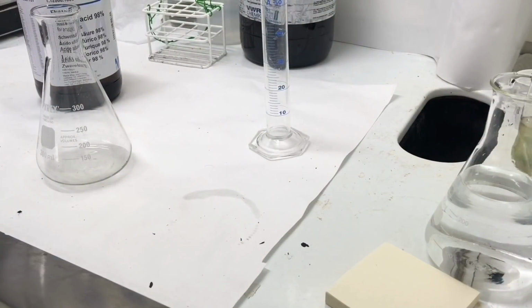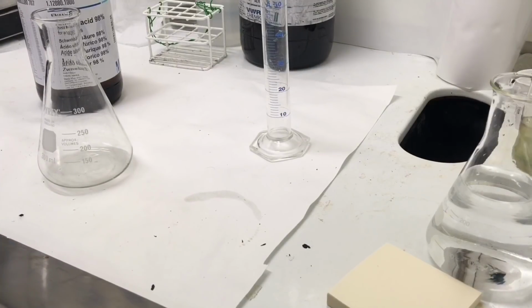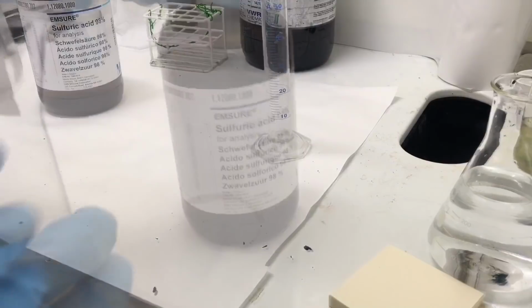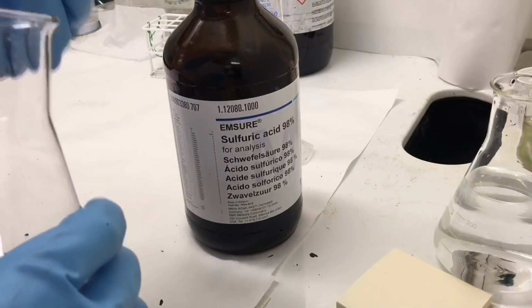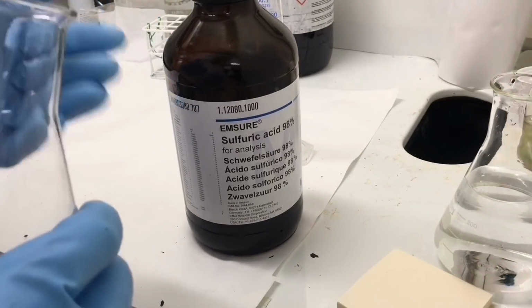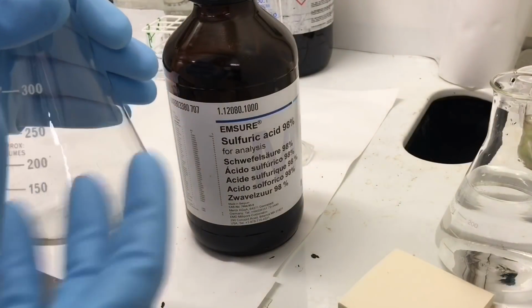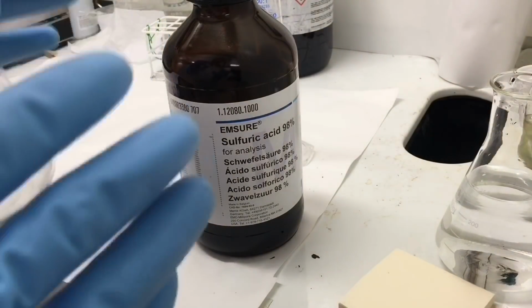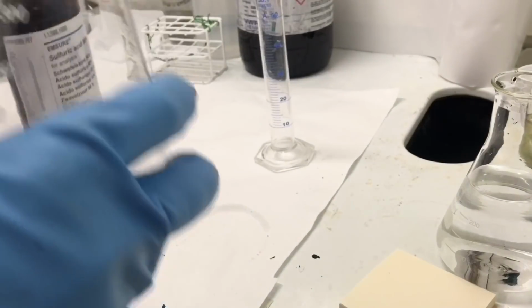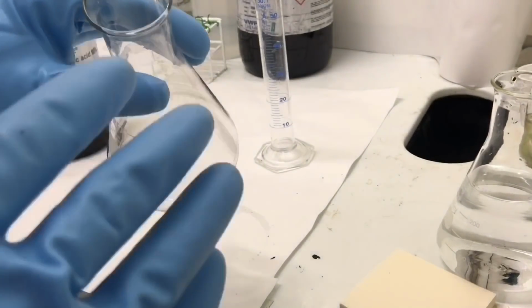First rule when mixing acids is you mix the acid into the water. The reason why you don't mix the water into the acid is because it reacts so hard with the water. So if I would pour water into this acid, it would basically react explosively. It would bounce off the surface, and in the worst case, somebody or you would get it in your eyes. So you always mix the acid into the water so that the water can take up the energy and the heat that is formed when the acid and the water react. Having said that, always work with gloves, safety eyeglasses, and in a ventilated area, and never look down into your mixtures.